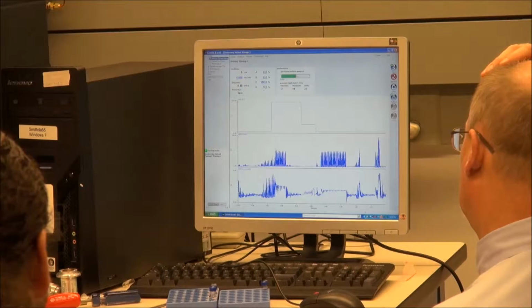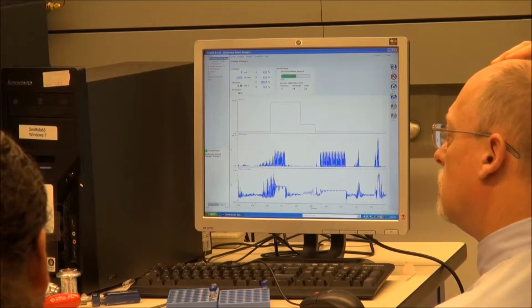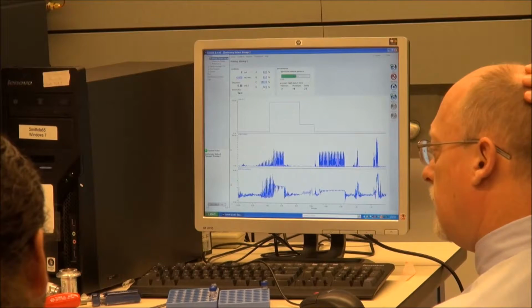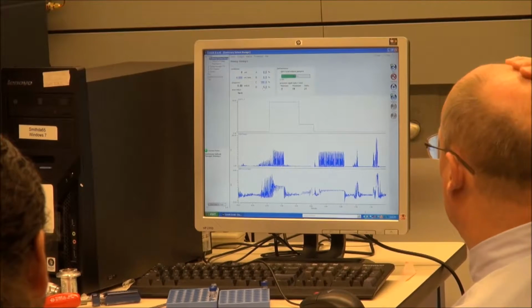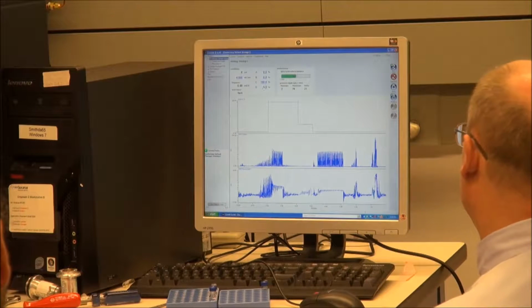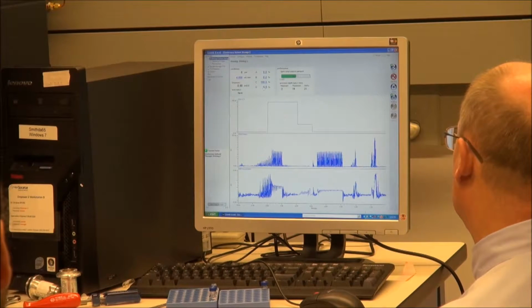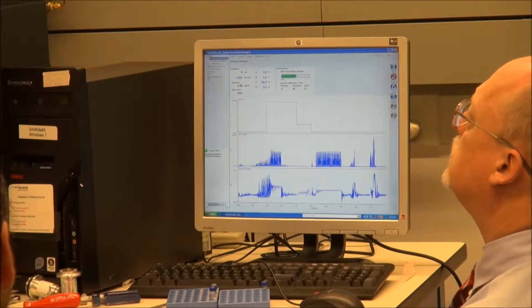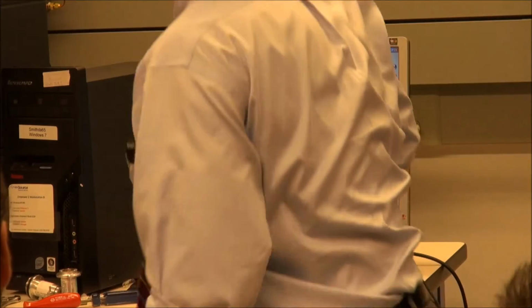Nothing happened. Well, it's off the scene now. Let's see now. And he actually has C loose, so now we should see C build up. Empty. Everything's empty. Is the solvent line in? Yep. They're all dropped in.